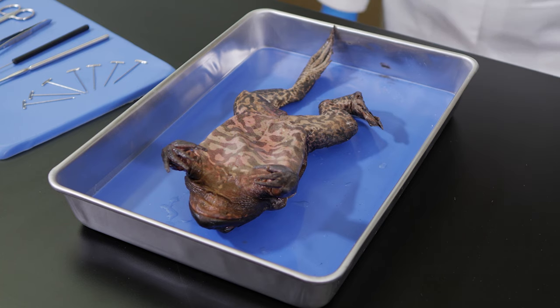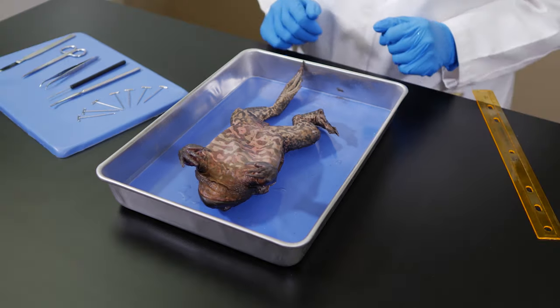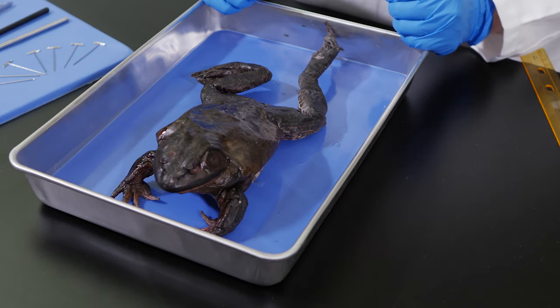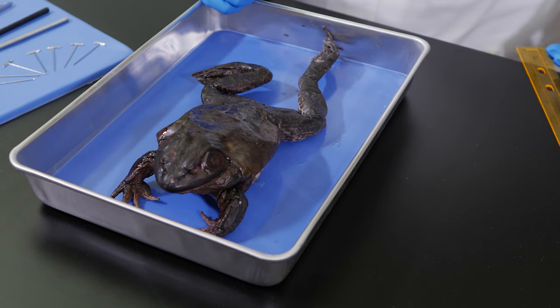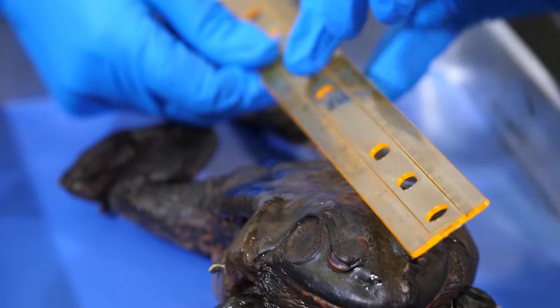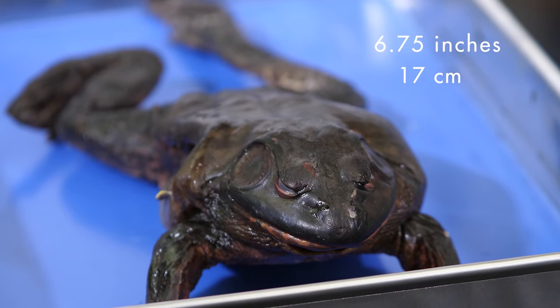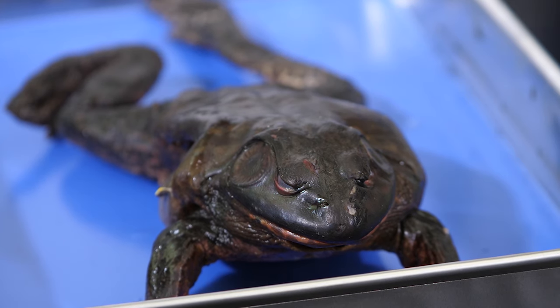The size of an animal sometimes helps us determine its gender, whether it is male or female. Fully grown female bullfrogs are larger than fully grown male bullfrogs. A female bullfrog will grow to be at least 7 inches, or 18 centimeters long, but a male will be shorter. Let's measure the length of this frog from the tip of its mouth to the end of its backbone — we do not include the legs in the measurement. We see that this frog is 6.75 inches, or 17 centimeters long. From this information, we know that its gender is male.